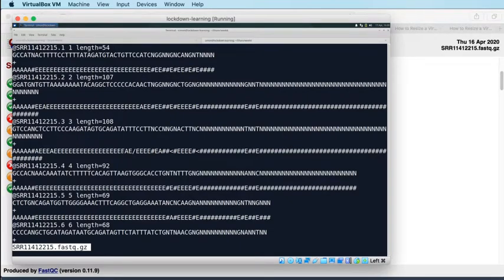That's because on modern Illumina sequencers, the quality scores are binned so they can only take particular values. Rather than having the range of all values from 1 through to 41, which is the usual range, on modern Illumina base callers your quality is limited to a certain number of values. I think with the NextSeq, it's something like 7 different values that the quality scores are binned into. That is mainly because it means that this file will compress more efficiently, so your resulting gzipped FastQ files will be smaller with binned quality than with unbinned quality.